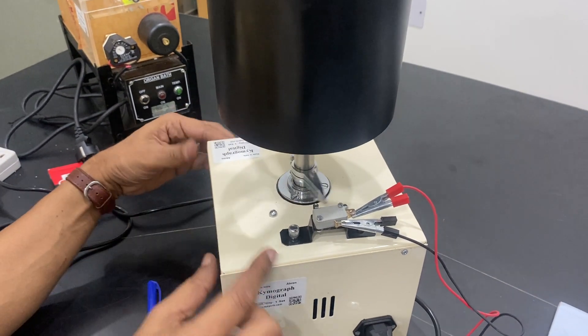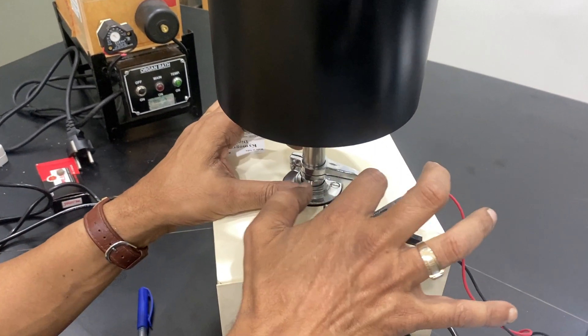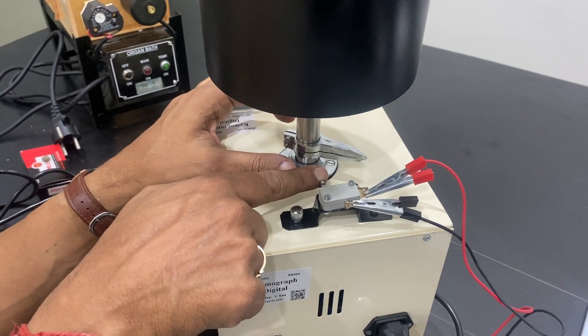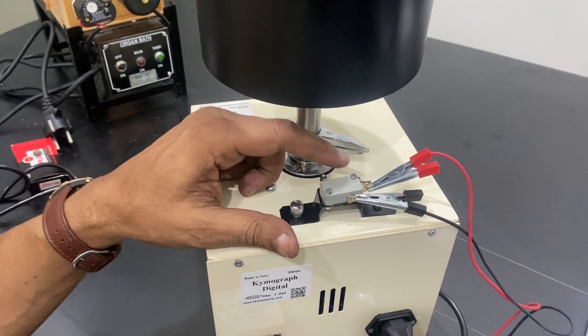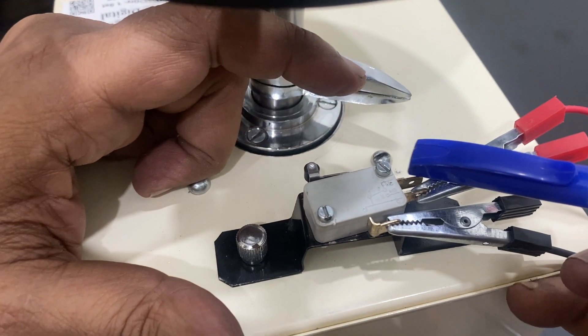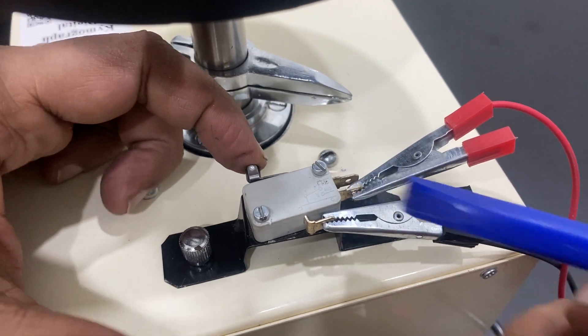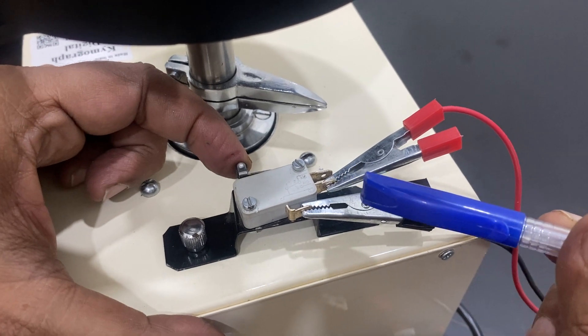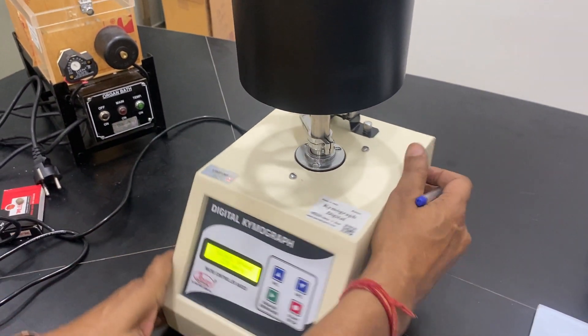You can connect them. These are levers which are going to initiate the on-off switch. There are two options. One is on this side, one is on this side. So either you can use the start one or the off one. This is an off position. If you press it, it gives a pulse at this time. So both the positions are available.